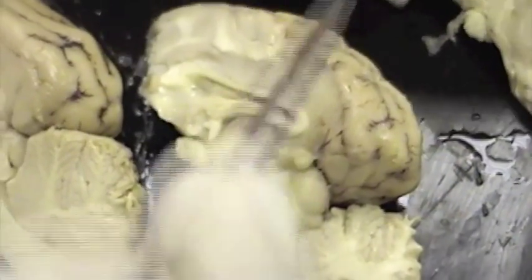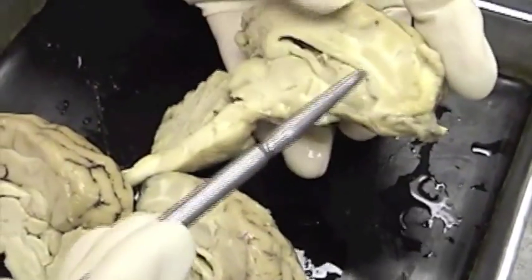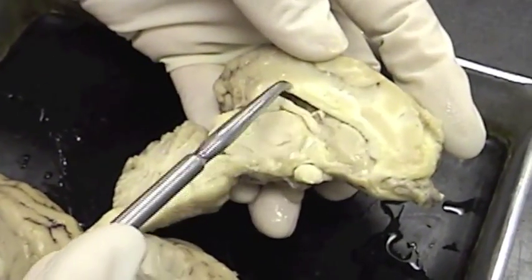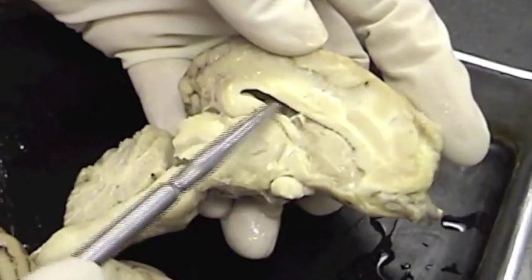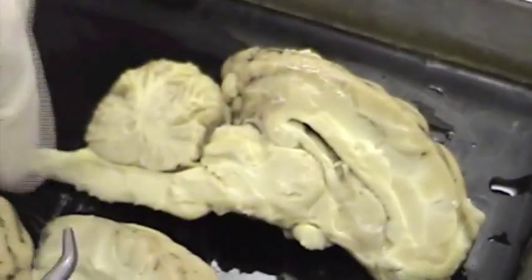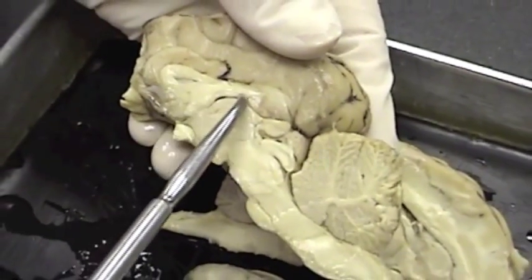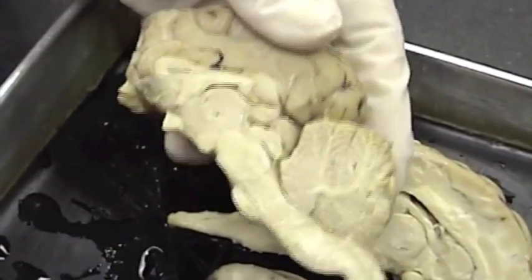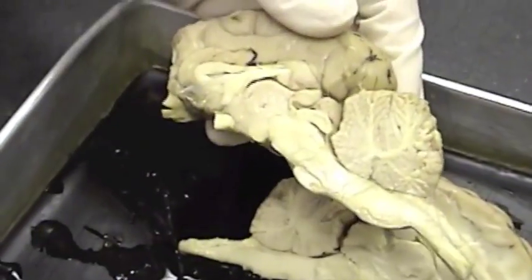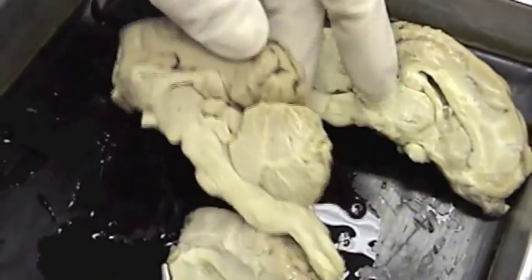On this brain, let me point out those same structures. Here is the corpus callosum, fornix, and lateral ventricle. On this brain as well: corpus callosum, fornix, and lateral ventricle. A little variation in appearance, but effectively the same structures.